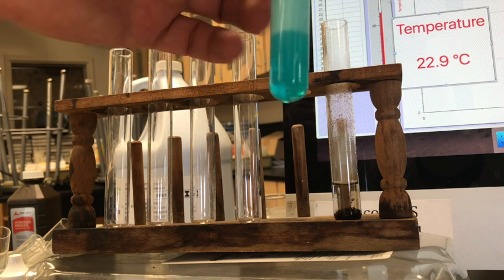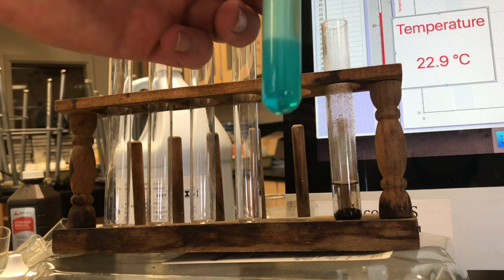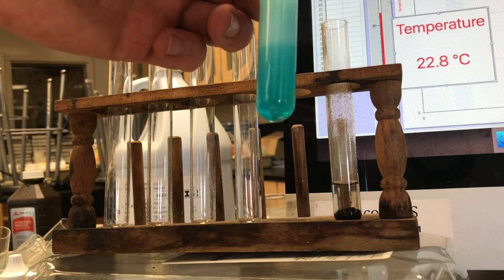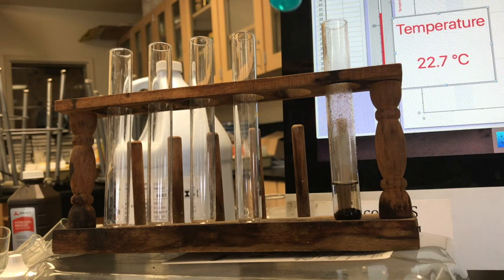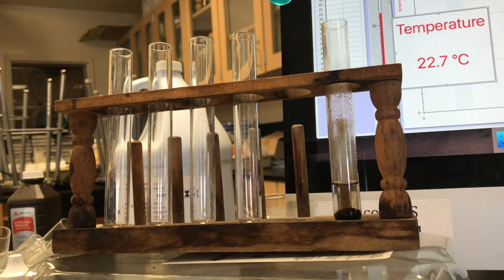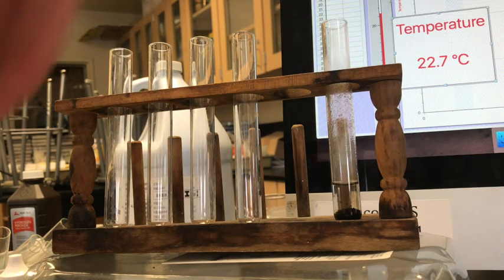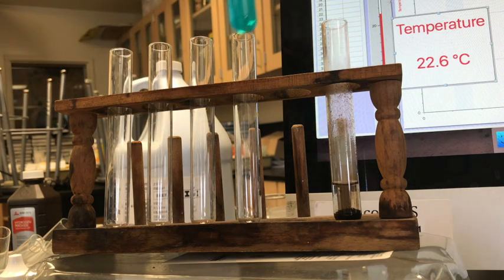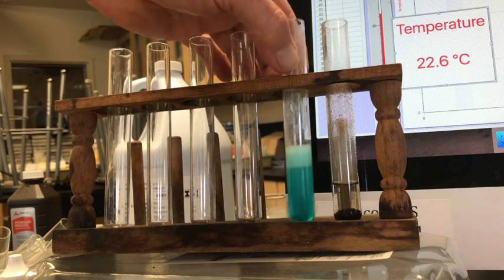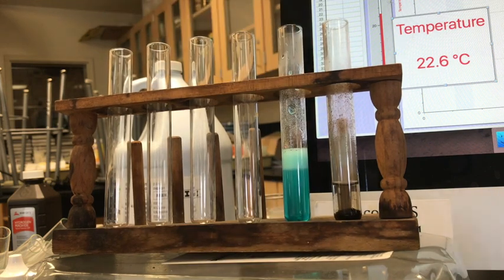And this is just like the water that comes from the tap that has air bubbles in it. We're getting some mixing going on that's causing air bubbles to be formed, not really making any new substance, I don't think, unless there was something in there. Nope. Okay, so there it is. And I know that got a little warmer, so let's look at the temperature.